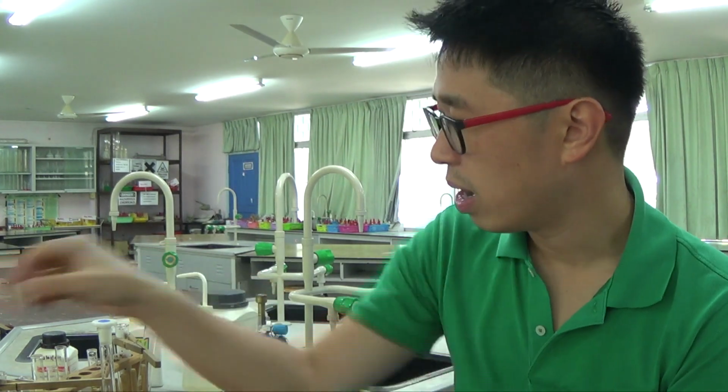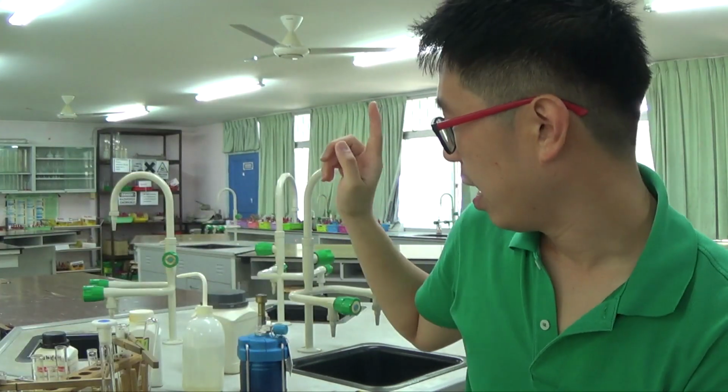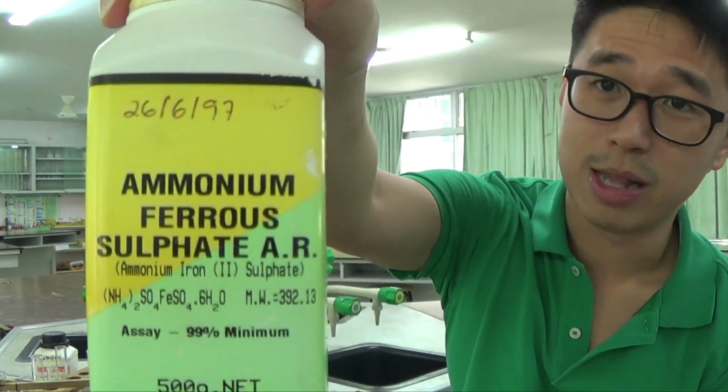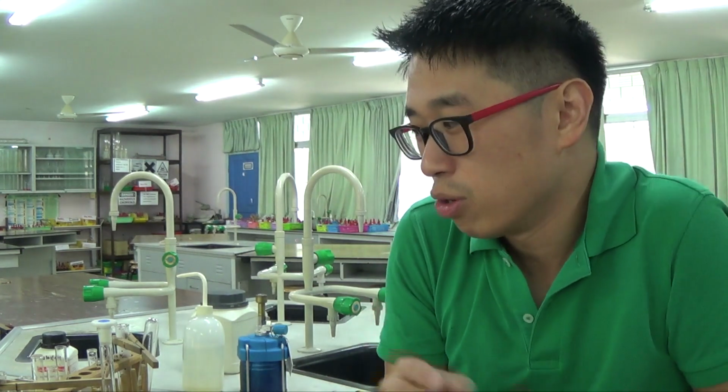I also talk about ammonium chloride and ammonium carbonate. It's the first one we talk about in the tutorial video, and the last one that I talk about is this double salt. This is actually more common in A-level chemistry, but you never know. It's practically just practical, no pun intended, and it's not a difference on A-level or O-level. It's just, can you do the practical?